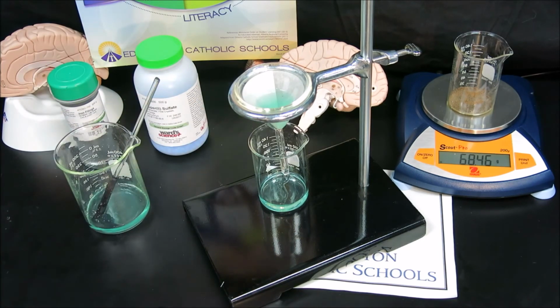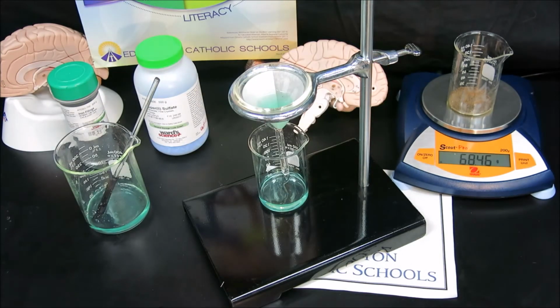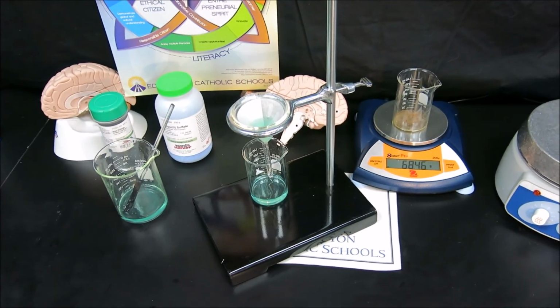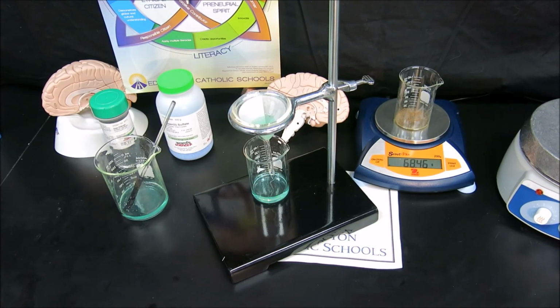The filter paper would need to be laid out to dry, and once the filter paper is dry, you'd weigh it similar to the beaker there, of course having tared the filter paper and recorded the dry filter paper mass before beginning this experiment. Either way, we collect the mass of our final product and we compare it to the theoretical calculated mass of our product using stoichiometry.